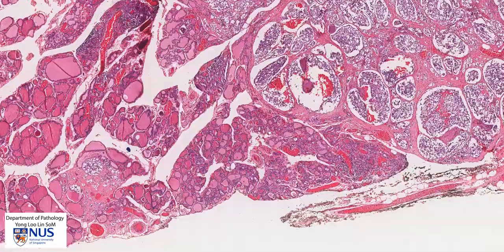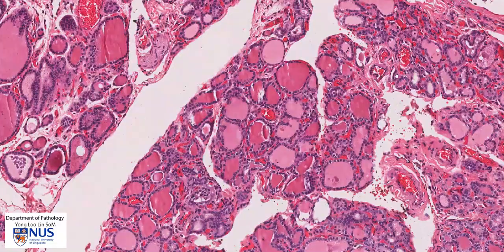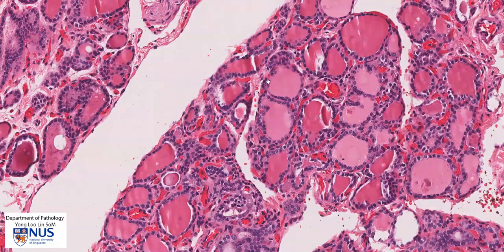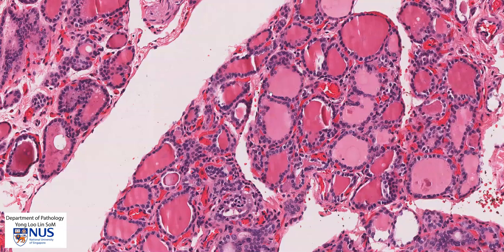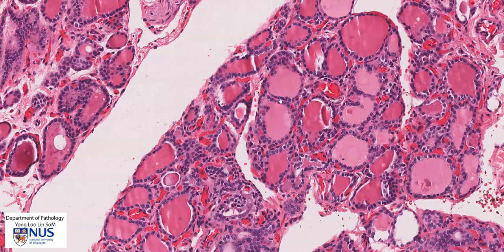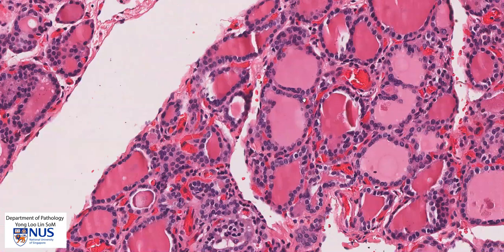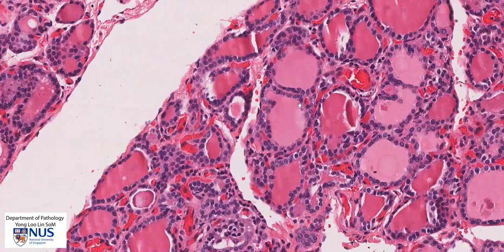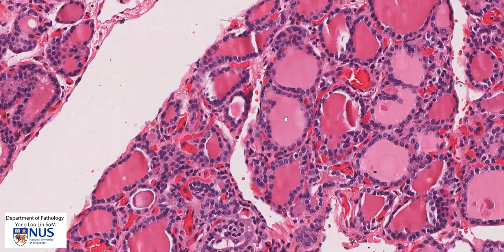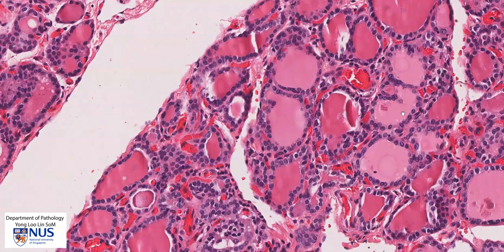I'm just going to do a very quick recap of normal thyroid, which is composed of these rounded follicular structures lined by cuboidal cells with very uniform round nuclei, and the follicles contain pink proteinaceous colloid material.